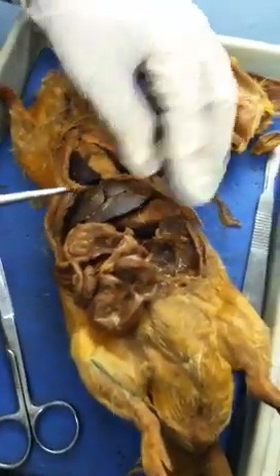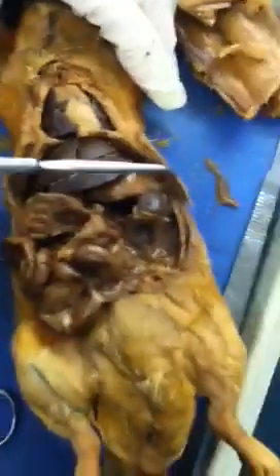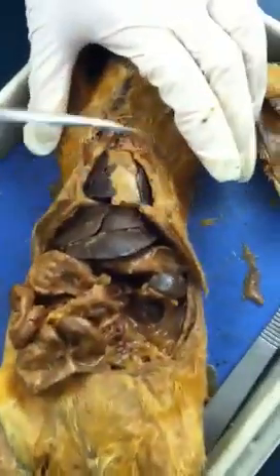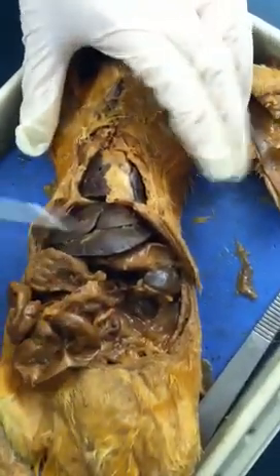Okay, so now I open up the rats. You will see two compartments — one will be the chest and abdomen.